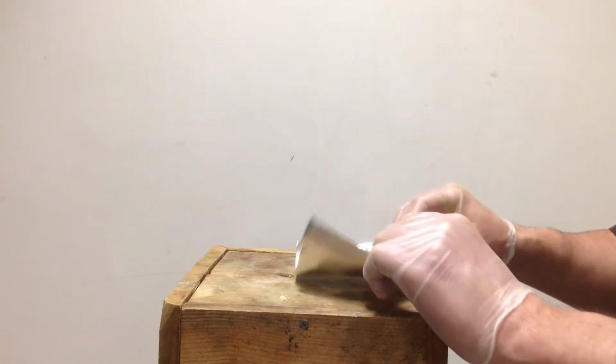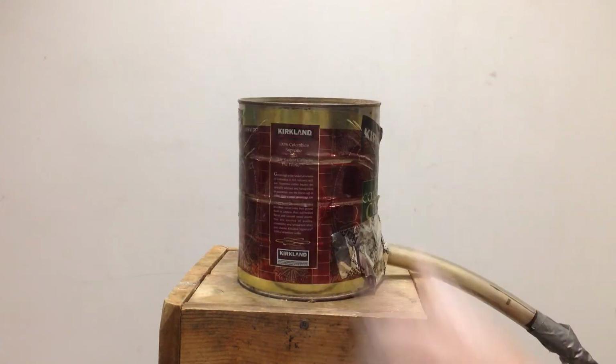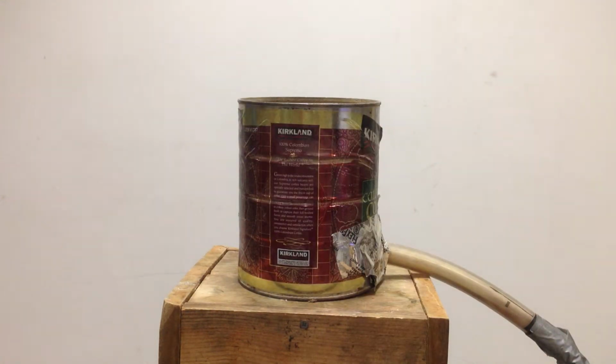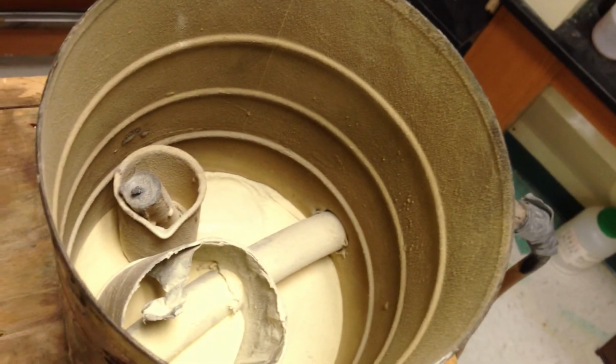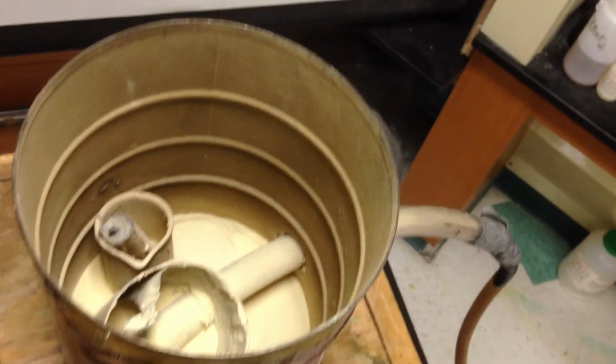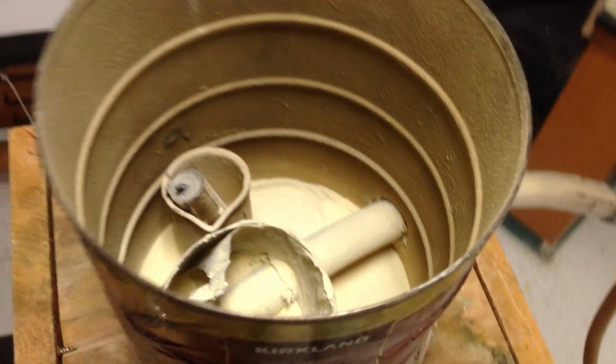So what I'm going to do is something called a grain elevator explosion, or at least it's going to be a mini one anyway. So what I'm going to do is take a can, as you can see here, and it's got a tube coming out, and inside the can I have a candle and I have some more sawdust. So let's take a gander at what's going on inside the can here. So inside the can, okay, you can see the candle I'm going to light, and here's the inner compartment where I'm going to blow air into to create the dust.